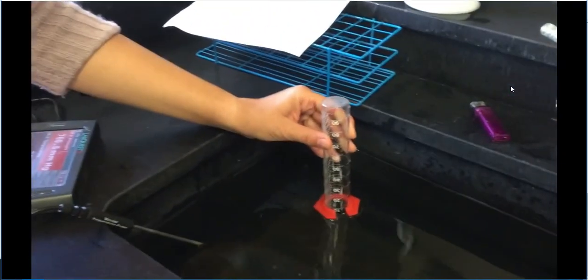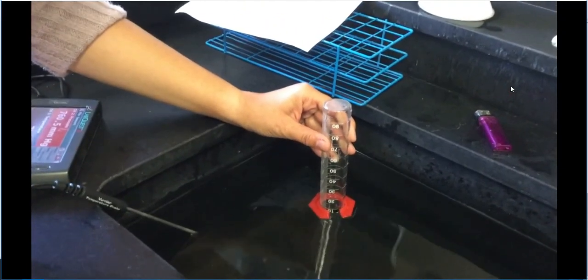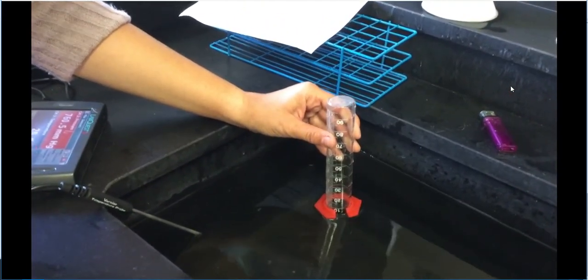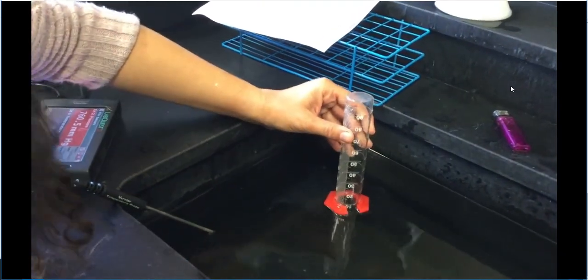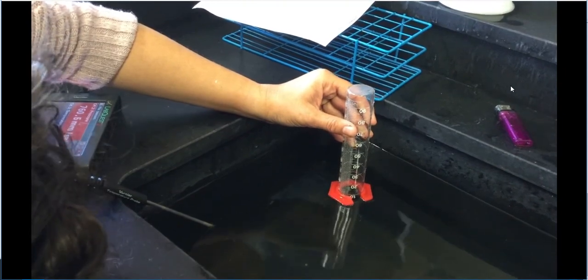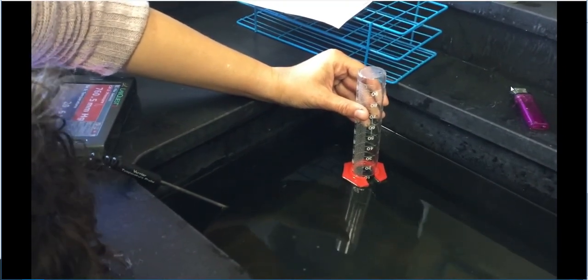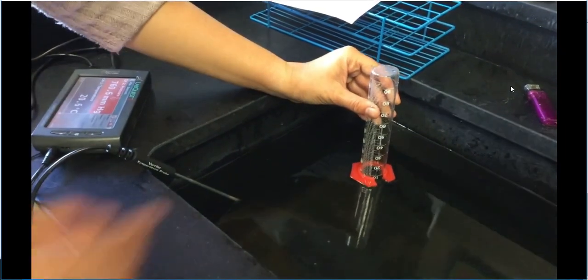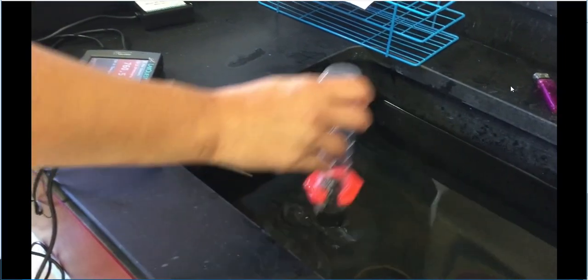Okay, so we had to equalize it because you always have to consider what's going on in the atmosphere, and that way you know that it's not pushing any more than it should be. So what we're going to do, let me go ahead and get that measurement. We are at 1 above the 10, so we are at 91 milliliters in. Pull this out.